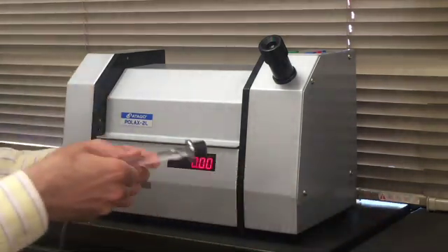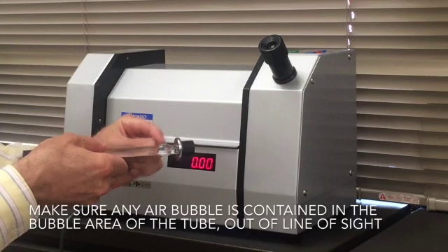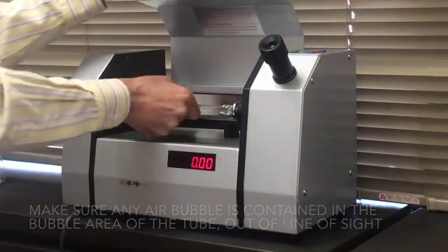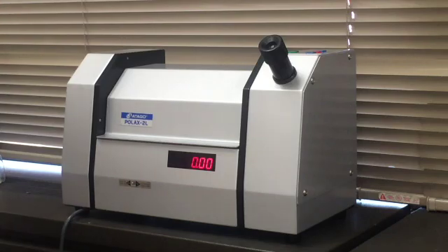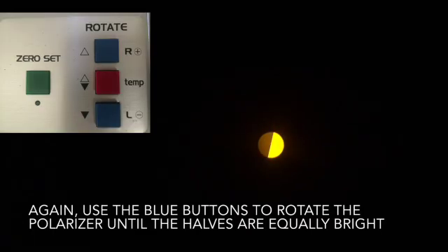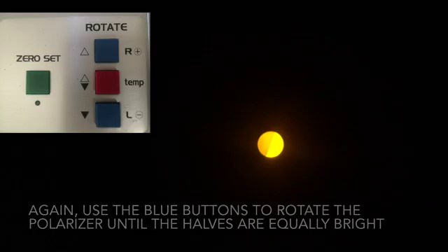Now I put my sample in, making sure that any air bubble is contained in the appropriate channel. That's pretty good. Here we go.